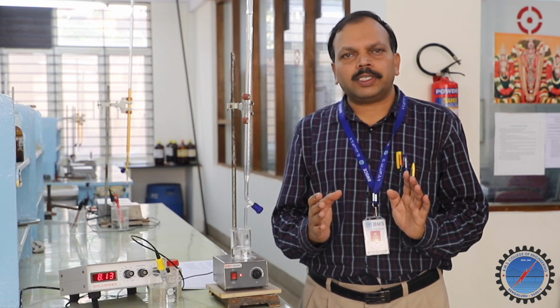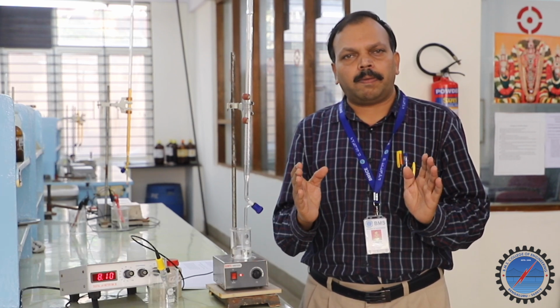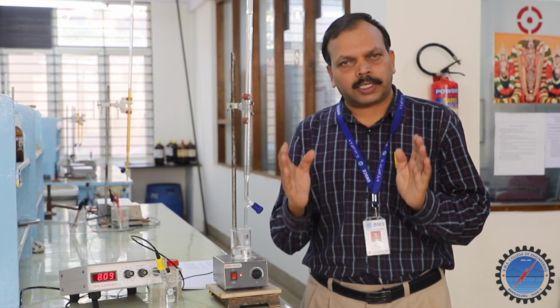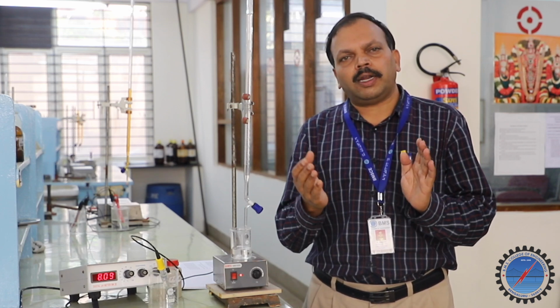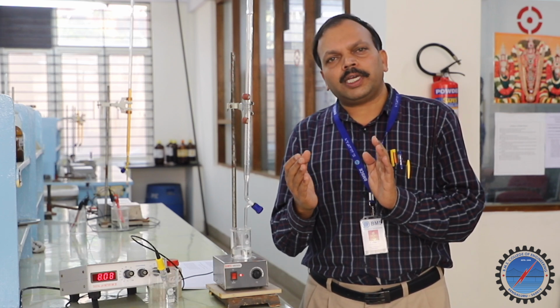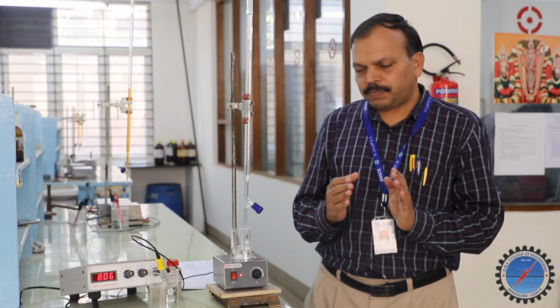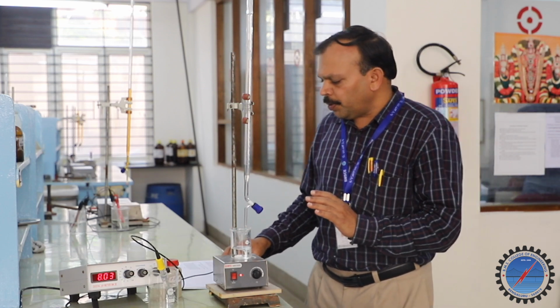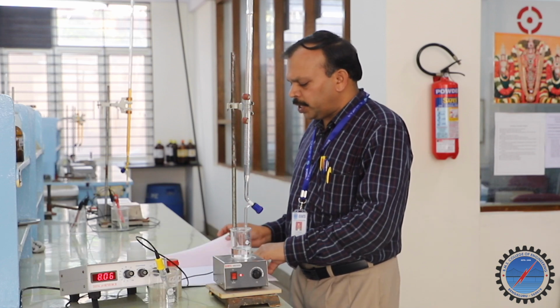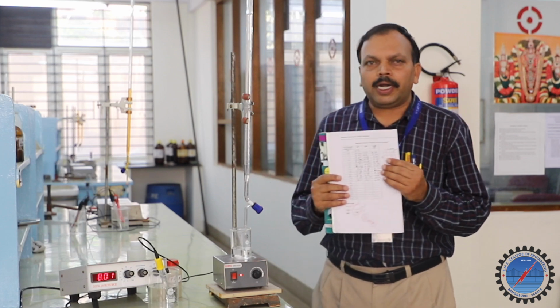The first graph is, we are going to take pH along the y-axis and the corresponding volume of NaOH added, 0.5, 0.5, 0.5, along the x-axis. For pH you can choose a scale of 1 centimeter as convenient. For the volume of NaOH added, 1 centimeter to 1 ml is a convenient scale. If you plot pH versus volume of NaOH, we are going to get 2 graphs. I am going to show the schematic graphs of how it is obtained from the tabulated result.